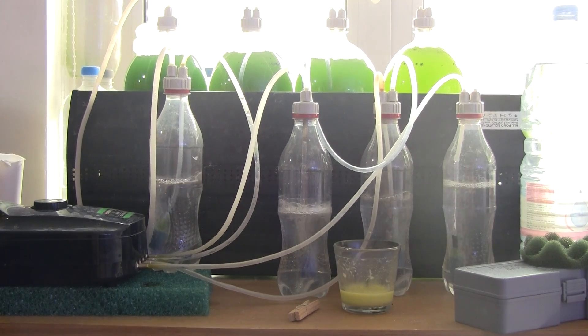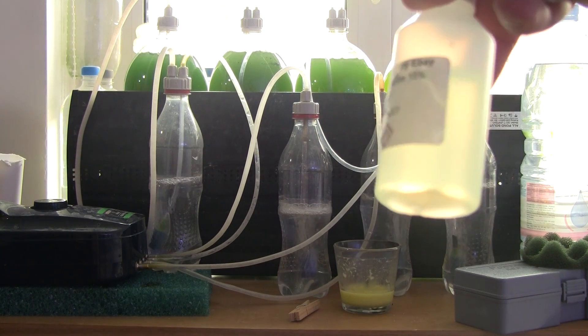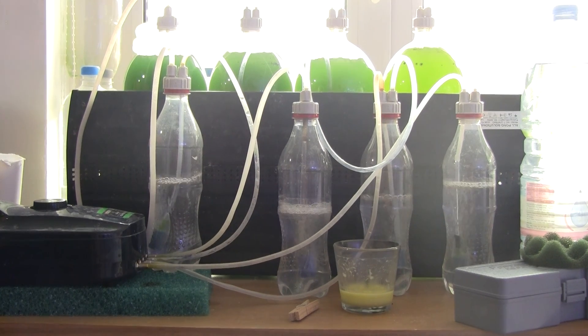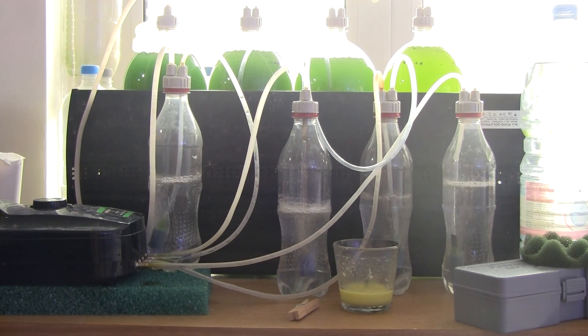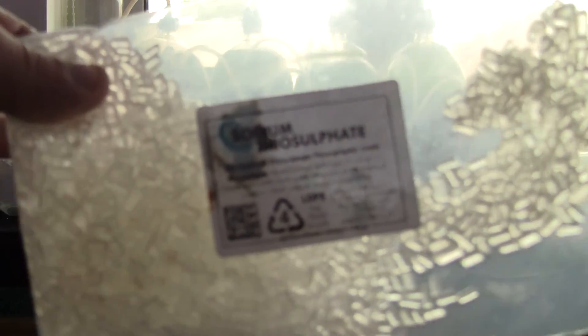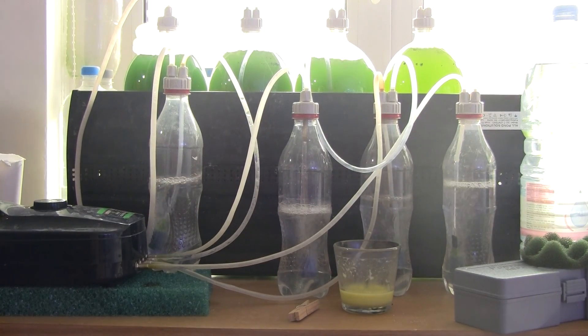It's really nothing special. Here it is — this is a 15% solution of sodium hypochlorite. Each milliliter will completely sterilize two liters of water. Obviously, you need to neutralize that, so we go to sodium thiosulfate. This is in crystals. What you do is dissolve 75 grams of these crystals into half a liter of water, and each milliliter of that solution will neutralize one milliliter of the chlorine solution.